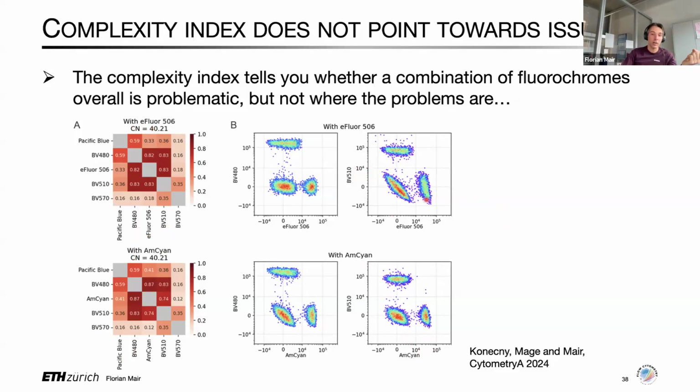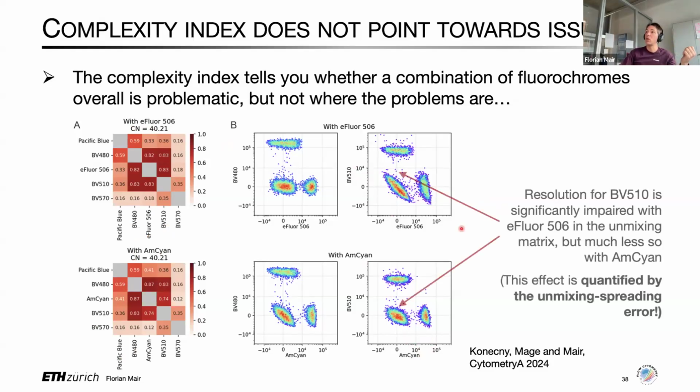In turn, if you calculate the unmixing spreading error, or if you calculate the adjusted stain index as I did before, you would be able to capture that effect and realize that with that combination of fluorochromes, you actually get better resolution on the BV510 by swapping from eFluor 506. So these are plots that are actually all published in OMIP-102 by now.